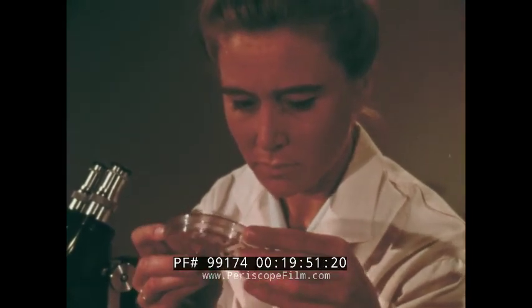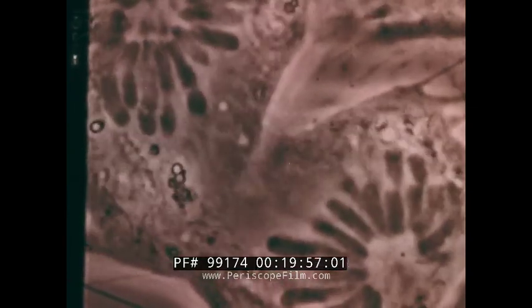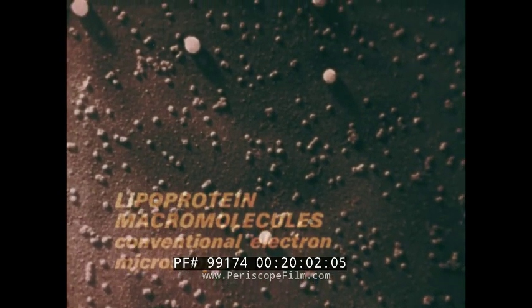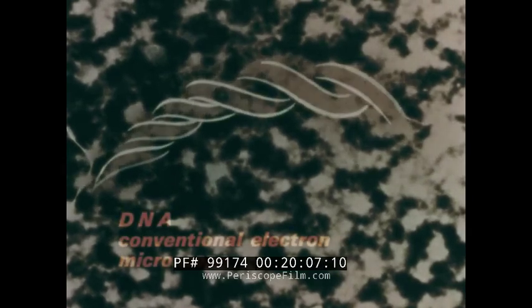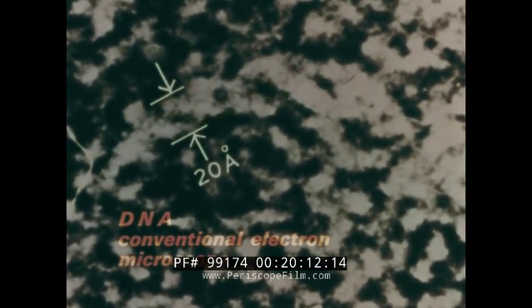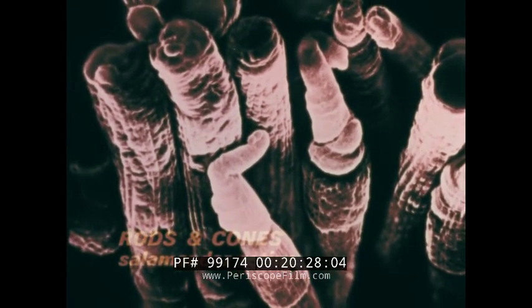For the imaging of much biomedical material, the light microscope is still most useful. For extreme magnification, the conventional electron microscope is unsurpassed. It has brought us this picture of what may turn out to be the double helix of DNA. But for the marvelous individual geometry of life, as in this view of the rods and cones of the retina of a salamander, the scanning electron microscope remains a true and penetrating eye.